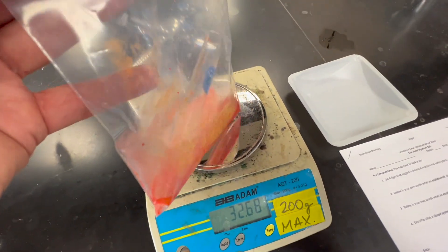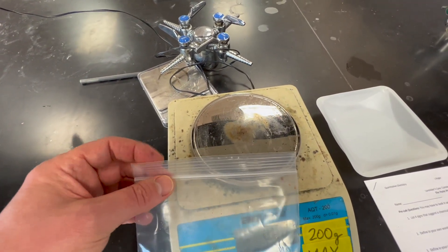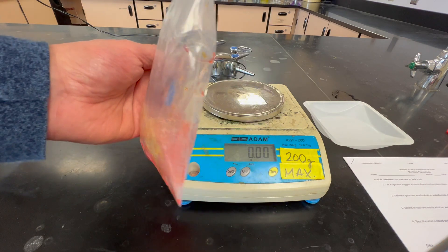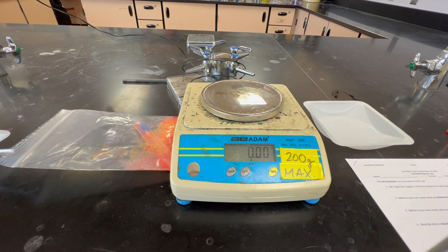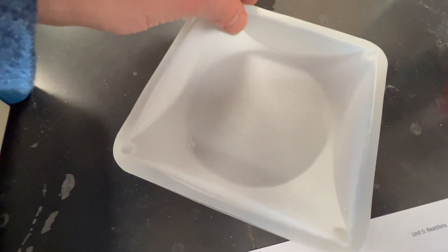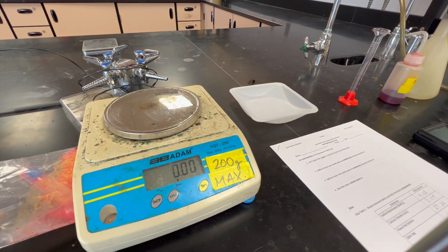This is something to keep in mind about what's happening in the chemical reaction. Despite our best attempts to make a closed system, it seems that we weren't entirely successful. But it's a lot easier to explain why the mass went down. Thinking back about our weighing boats where we originally weighed the chemicals — again, it is a lot easier to explain how the mass would go down, but not so easy to explain an increase in mass.